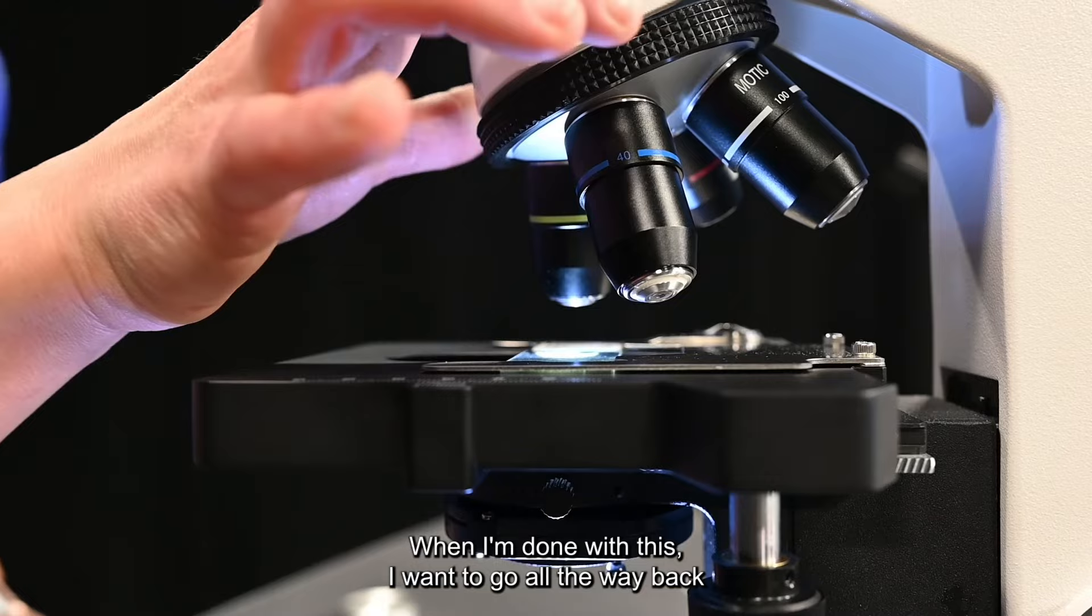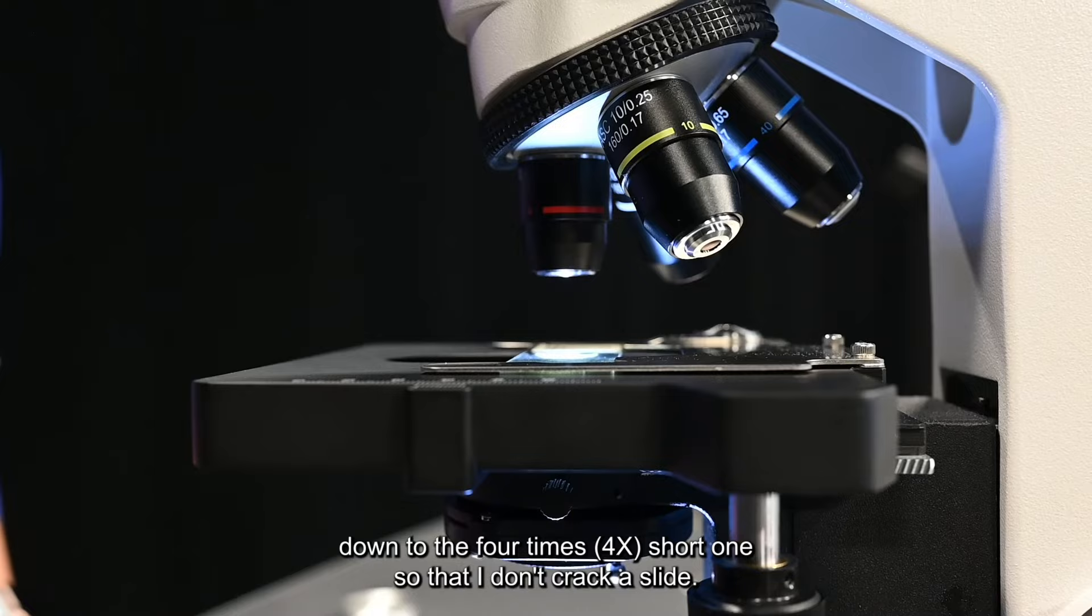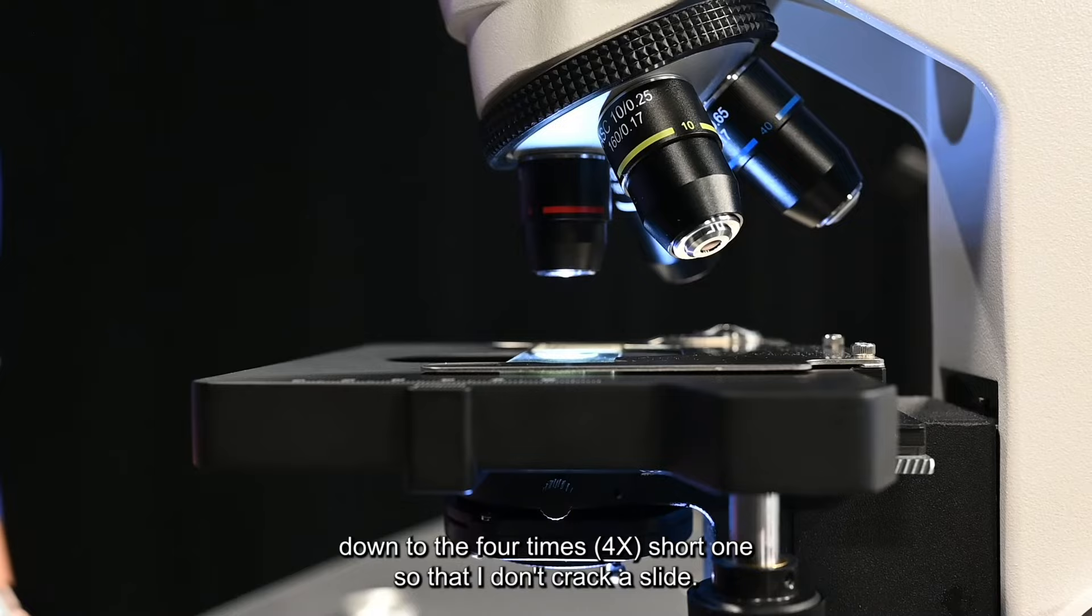When I'm done with this I want to go all the way back down to the four times short one so that I don't crack a slide. Pull this to the side and then I remove my slide and I'm done.